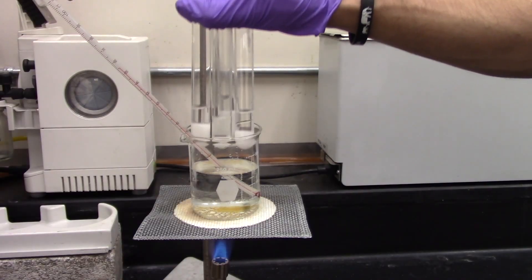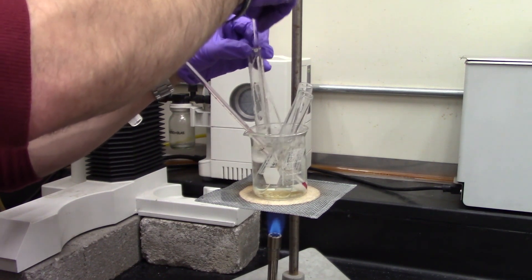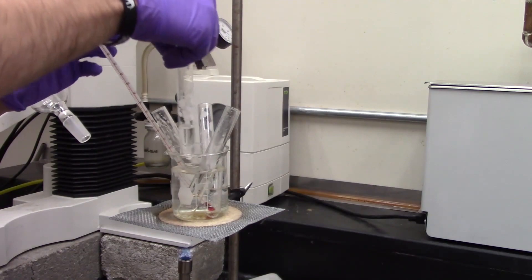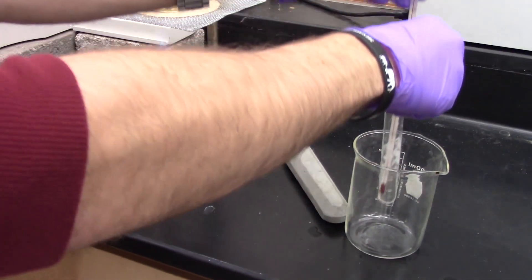Place a thermometer and the test tubes in the water bath and stir each test tube with a glass stir rod until the potassium nitrate is dissolved. Take one test tube out of the bath, along with a thermometer and observe the first sign of crystallization as it cools.